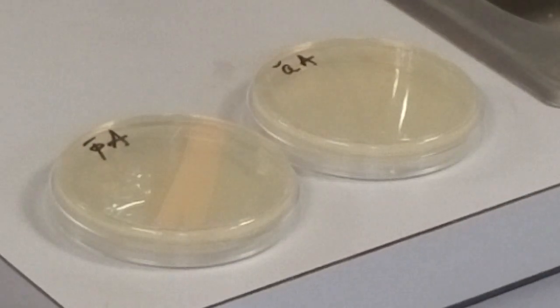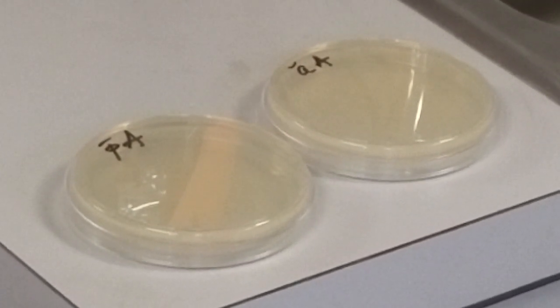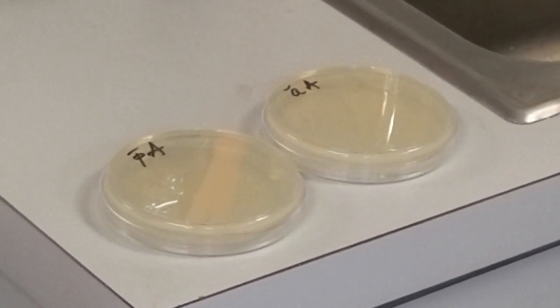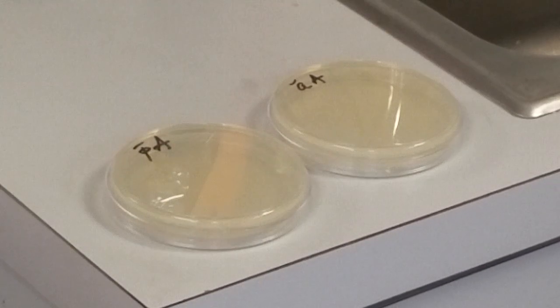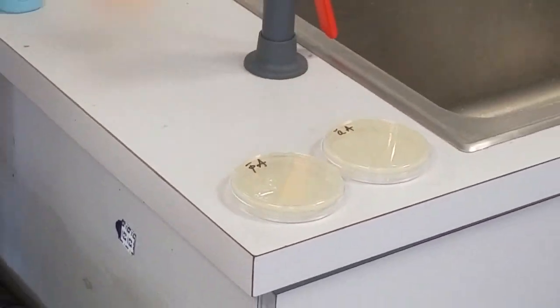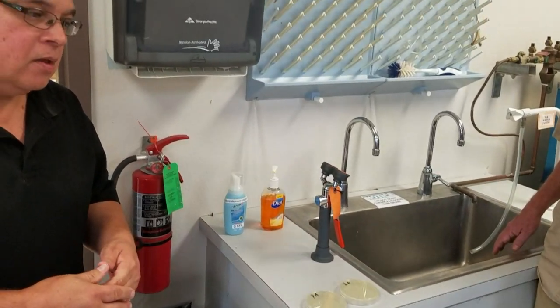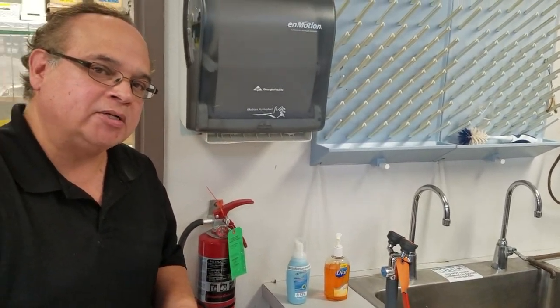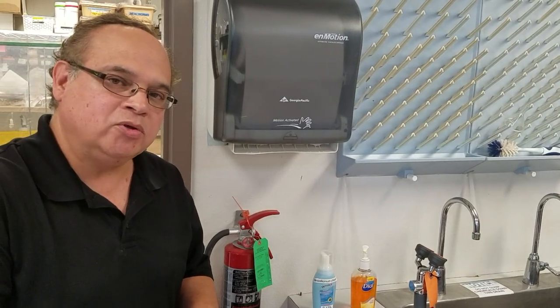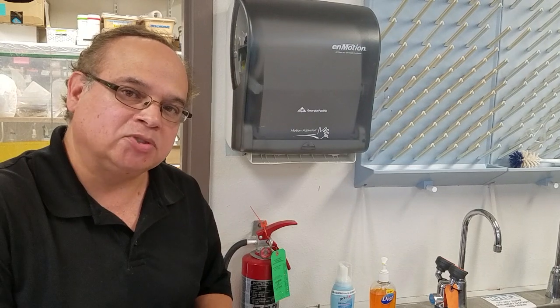Welcome to microbiology. We're going to do a hand washing exercise and compare four different treatments. The first treatment will be just using water. The second will be soap and water. The third will be hand sanitizer only. And the fourth will be soap and water followed by hand sanitizer, which is the way it's supposed to happen.